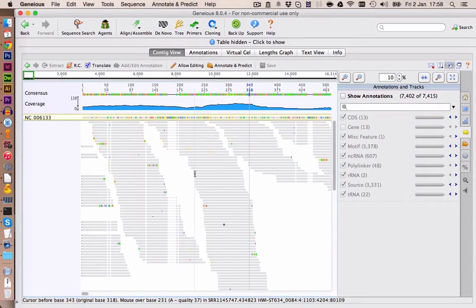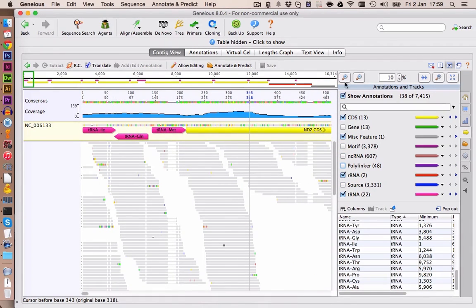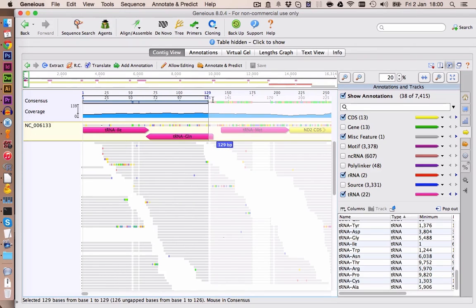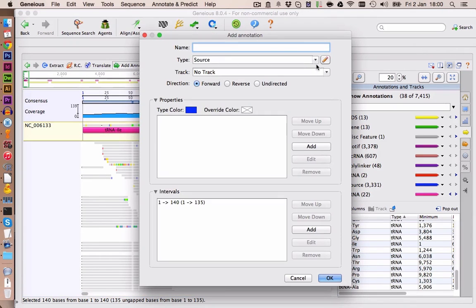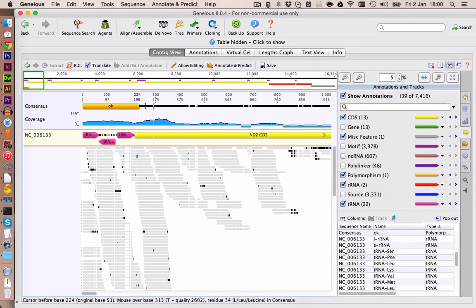Let's annotate regions which have good coverage and are very likely correct with an own annotation in the consensus. Actually, let's just hide the annotations we made, and we keep the annotations of the reference genome, so we have an easier time adding our annotations. This should be fine. Let's zoom in a bit more. So to add an annotation on the consensus, we select the region we want to add the annotation to and click on Add Annotation. Let's select an annotation which isn't used already, and we want to have this undirected. Let's call this OK. Now we can extend the annotation how we want to have it. This is all looking pretty good.